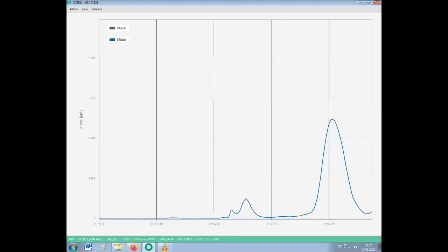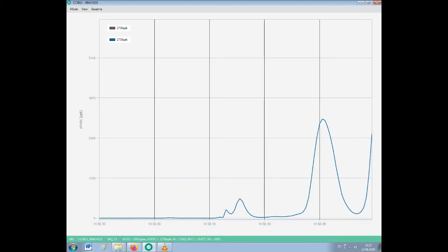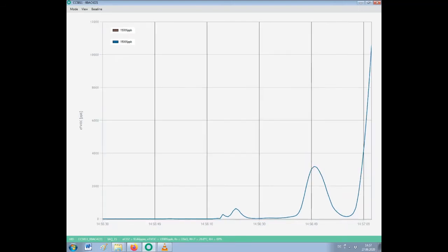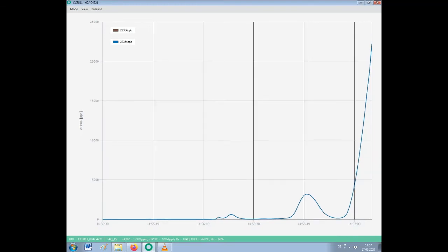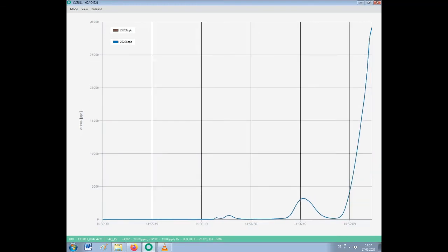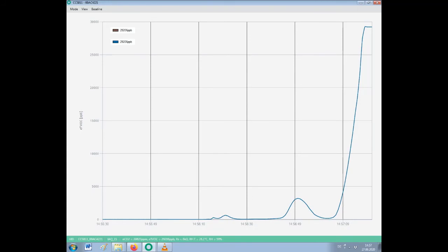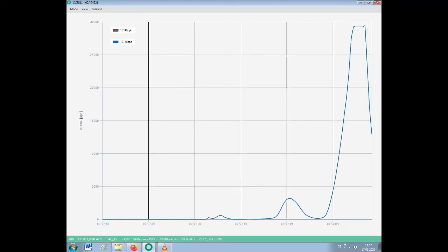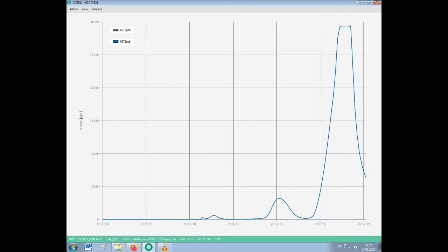In the chromatogram you can see four peaks. The first peak is, I think, CO2 from the headspace. The second is some pollutants or side products of the fermentation. The third peak is methyl ethyl ketone, and the fourth is the ethanol, because it's the biggest peak.